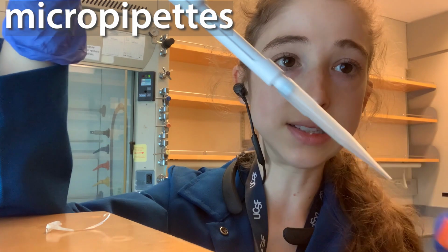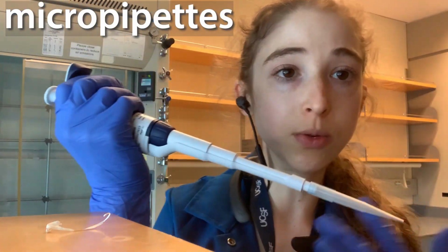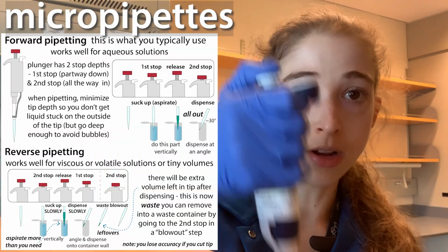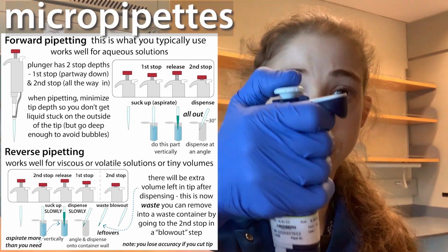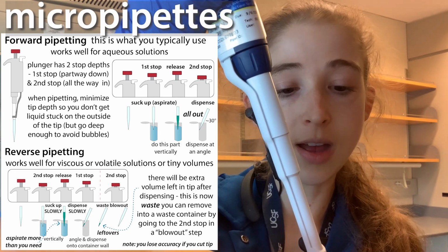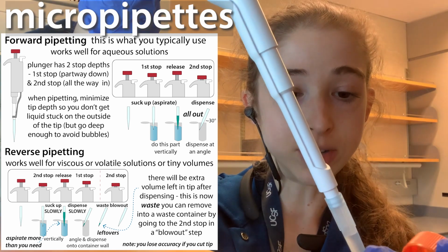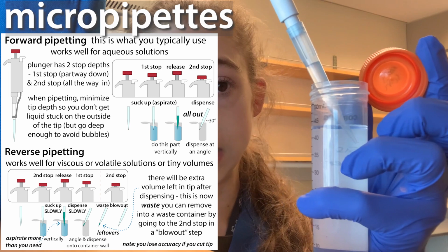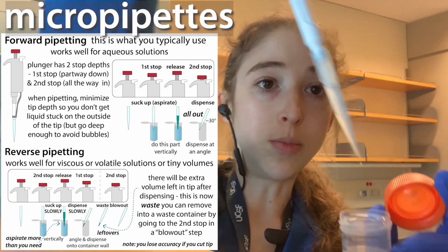Speaking of pipetting, more on this in another post, but typically with these pipettes, we're doing forward pipetting, where you push down and go into your liquid. There's basically a first stop and a second stop. The first stop is for measuring, so you go down to the first stop and you pull up. After, you want to make sure the liquid goes all the way up. You want to put your pipette just in the top of the liquid. You don't want to get excess liquid stuck on your pipette tip. You pull up, and then you pull out.